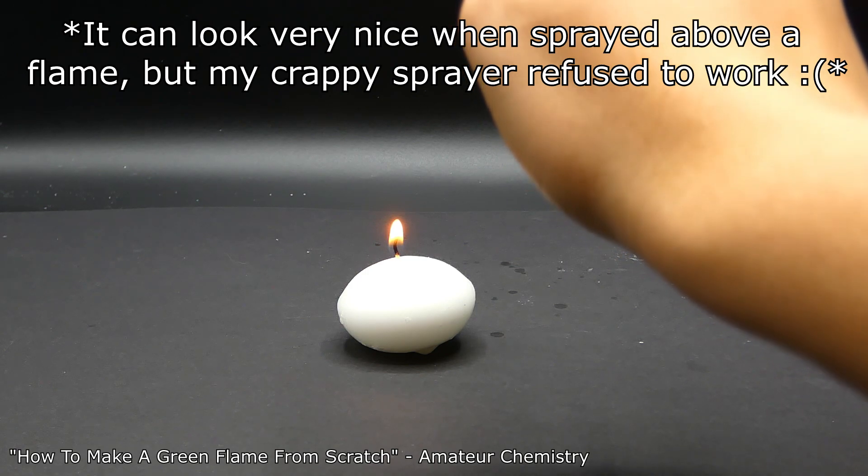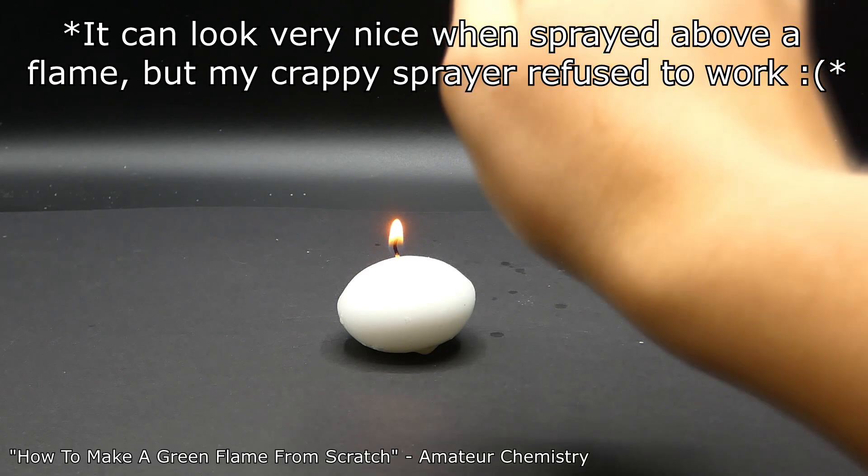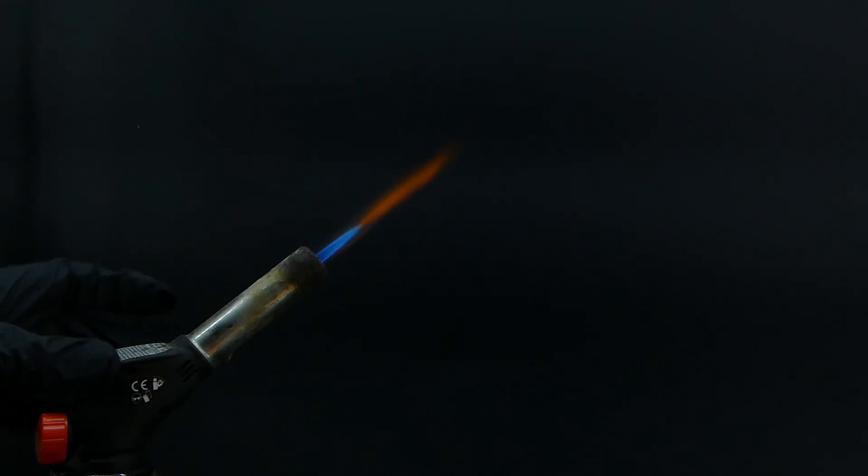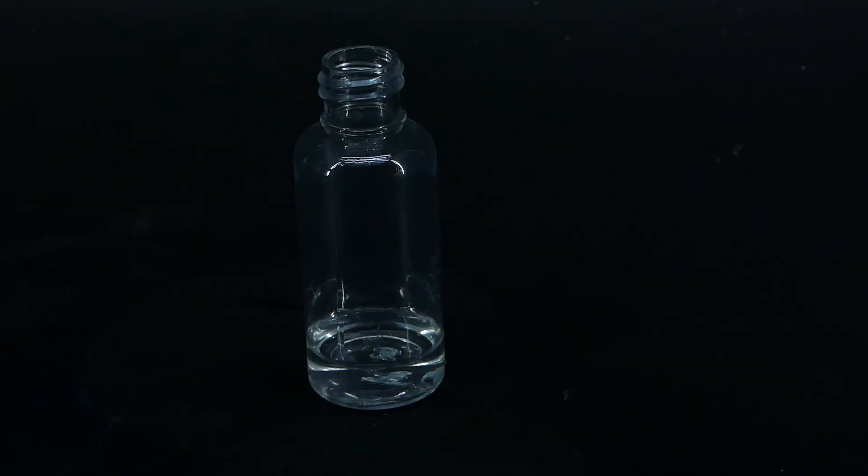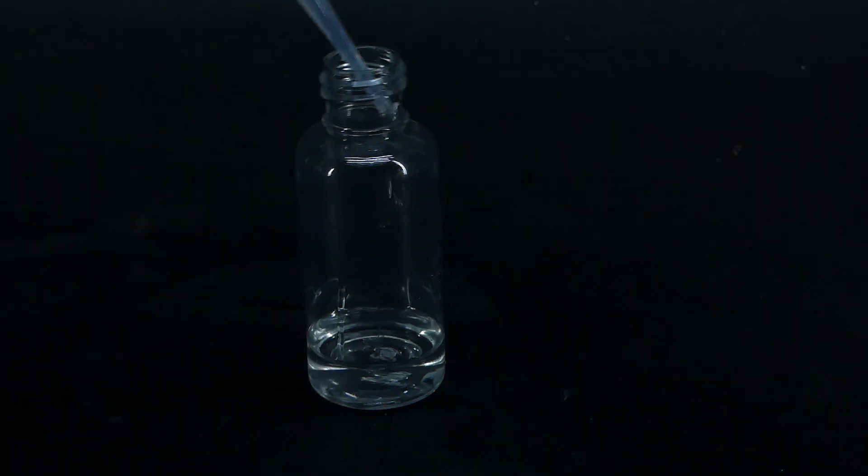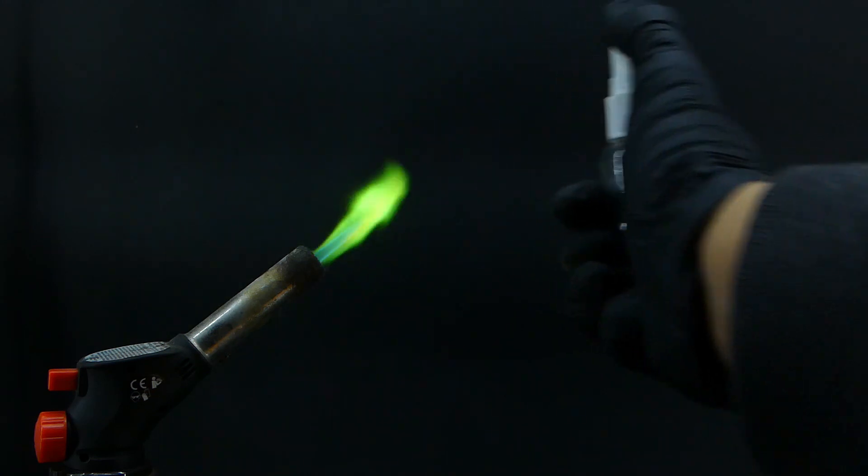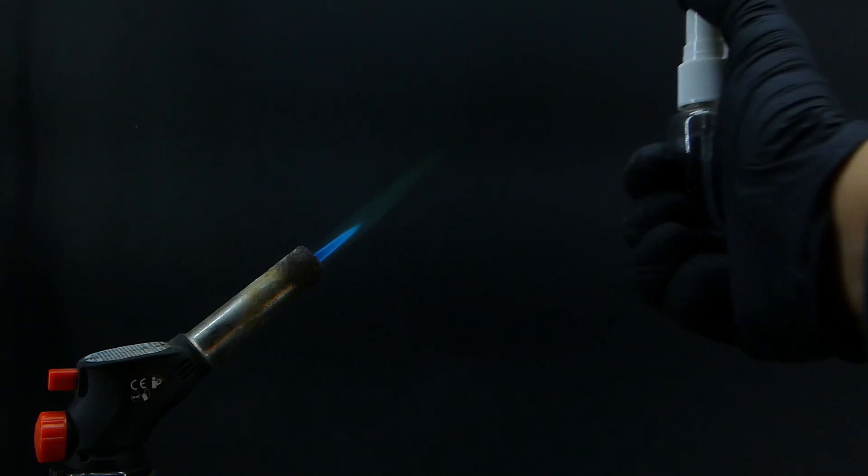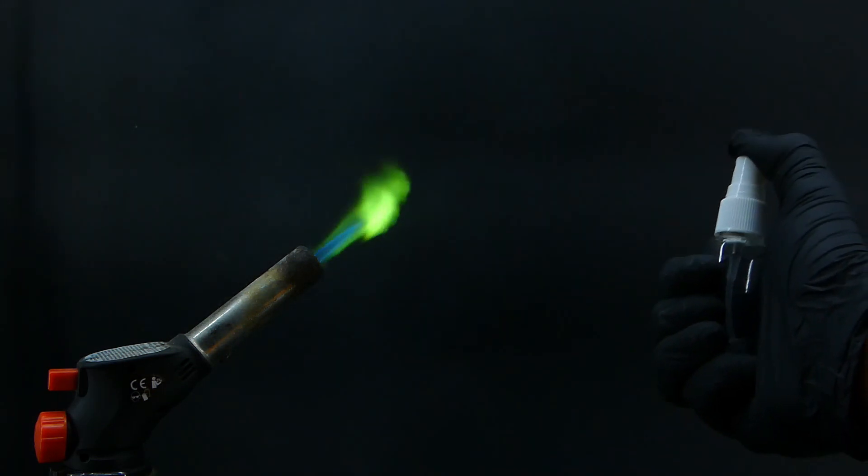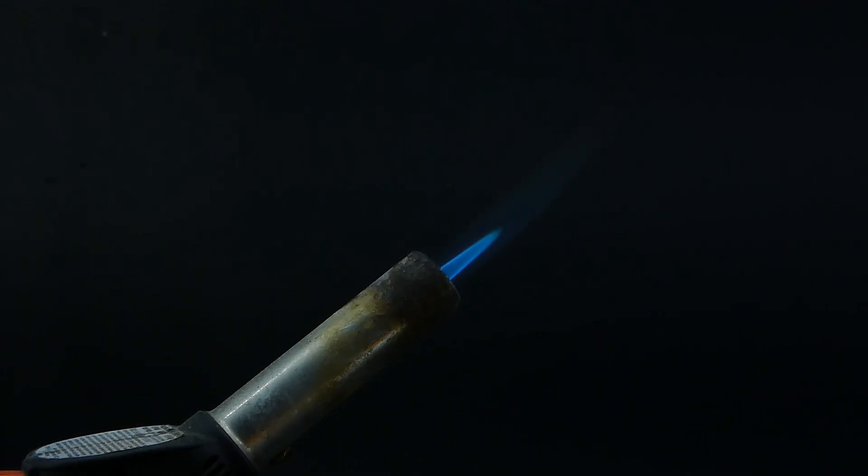It didn't work because my setup wasn't the greatest, but now I upgraded it. Instead of a candle, I have a blowtorch and a different sprayer that works, filled with trimethyl borate. At first, it just dyed the flame green, but after learning how to aim this thing, I managed to produce a green fireball.